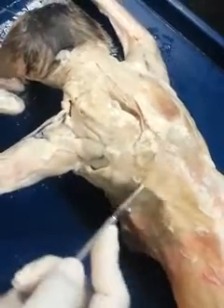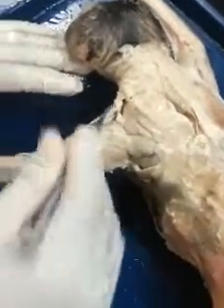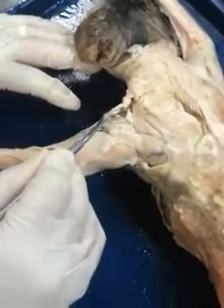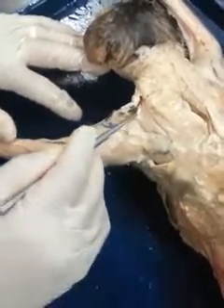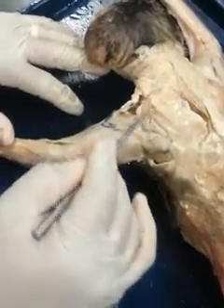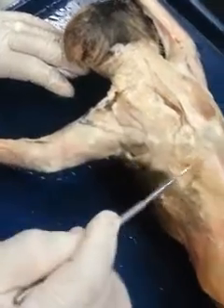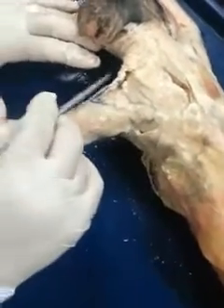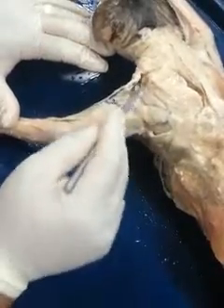And you can see that I'm under the spinal trapezius here. For the deltoids, you have the clavodeltoid, the acromiodeltoid slightly deep to that, and the spinal deltoid here. And then kind of separating the two, you have the levator scapulae ventralis. So clavotrapezius, acromiotrapezius, spinal trapezius, clavodeltoid, acromiodeltoid, spinal deltoid, levator scapulae ventralis.